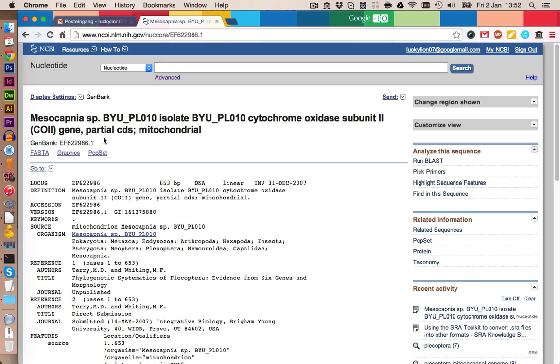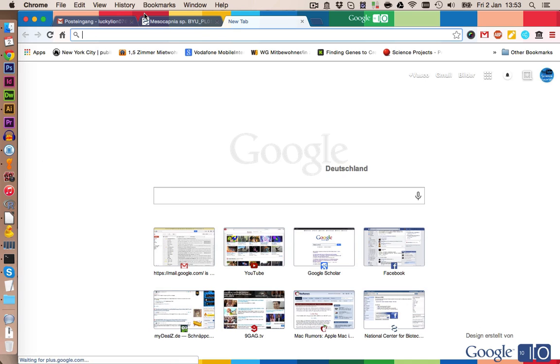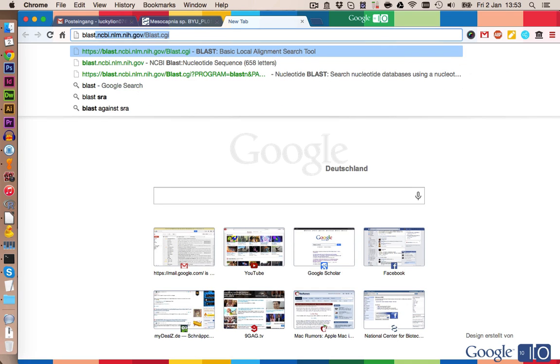This is another genus probably, but we're just going to use this one here as a blast query to figure out which mitochondrial genome of Plecoptera, which is available online, is the best hit, the best match, and which we can use to filter out some of the mitochondrial sequences in our dataset. To do this, we're going to copy the GenBank ID. Let's open a new tab, and we're going to blast.